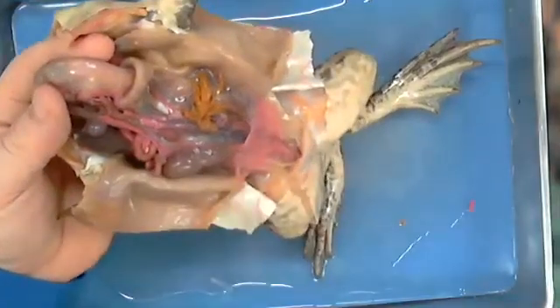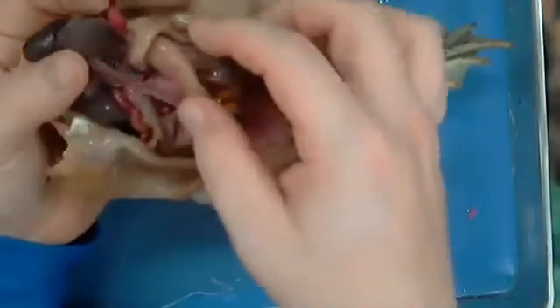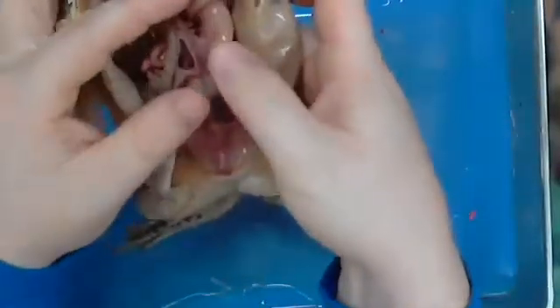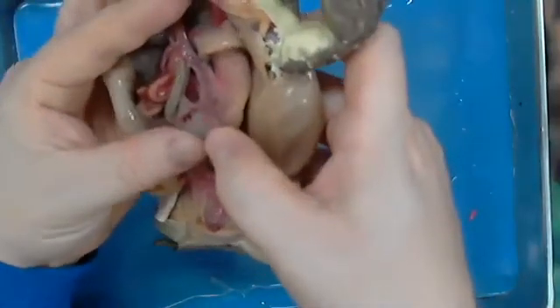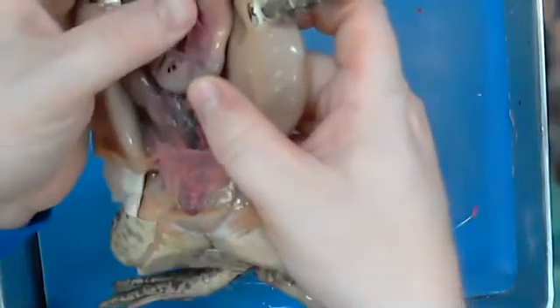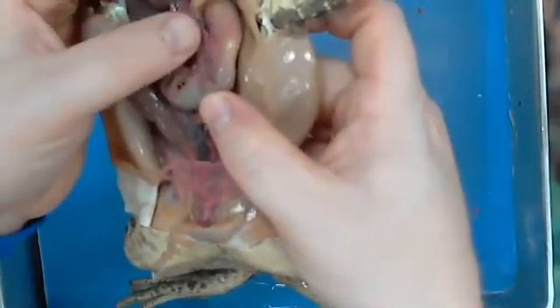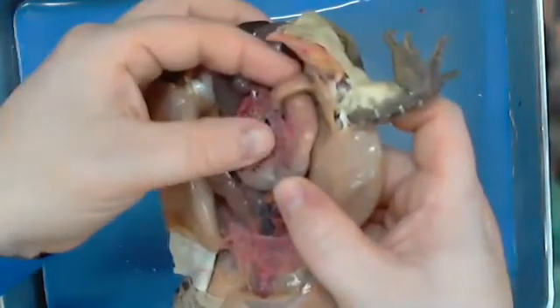And then another word that you guys have talked about a good bit happens to exist here at the top of our stomach. This pink area that's attached to the top of the stomach, I'm going to turn it as best as I can for you to see. This pink area happens to also be another organ. What is it that attaches to the stomach? Kidney?